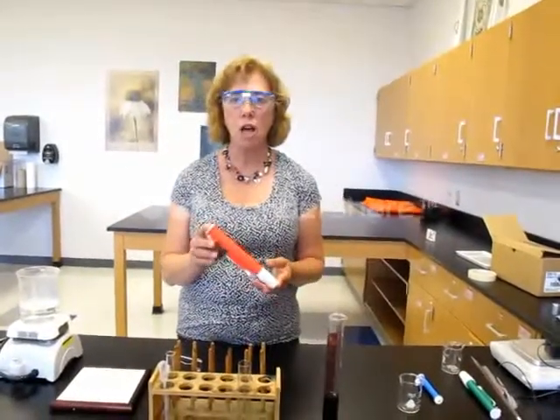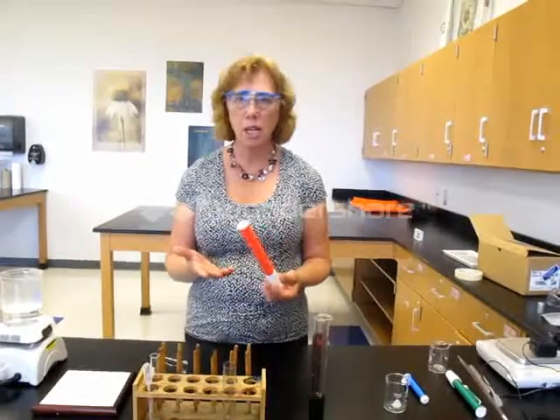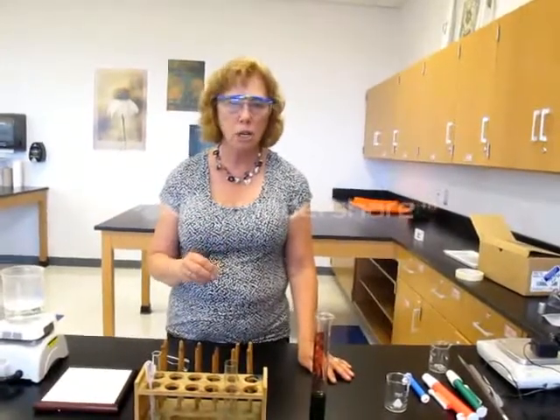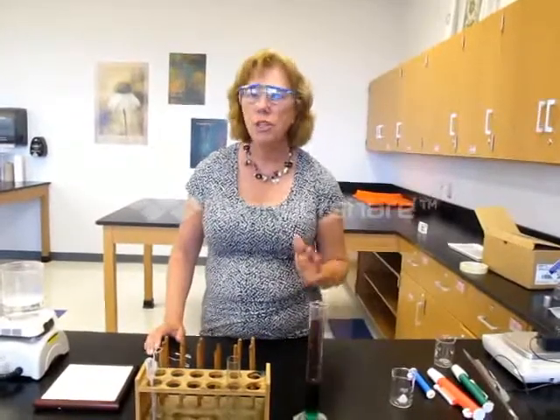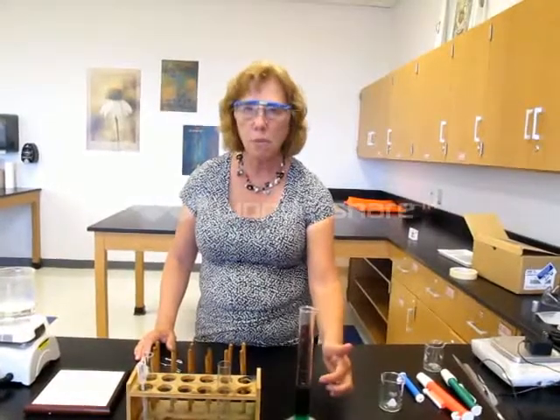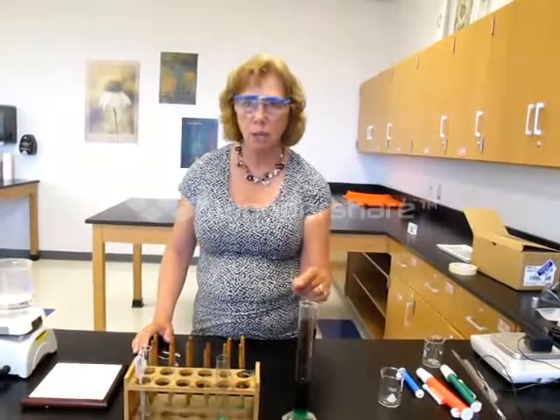In the last segment you learned about how we can precisely measure smaller volumes of liquids that we might need to use in a lab. If you're going to have to measure a volume much larger than 10 milliliters, you will probably do so in a graduated cylinder. Remember when you're reading the volume on a graduated cylinder, you want to look at the meniscus and you're reading the bottom of that meniscus as the volume of that liquid.